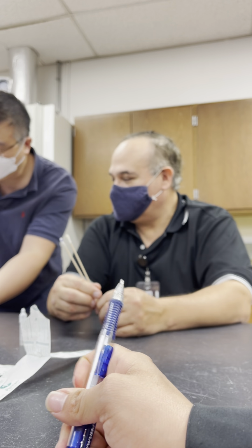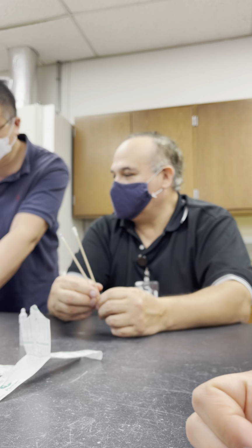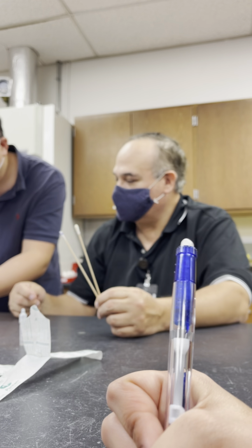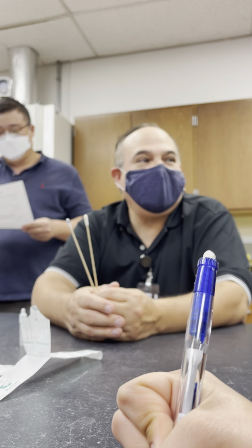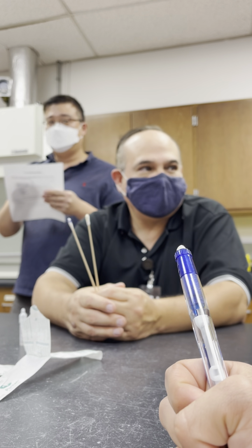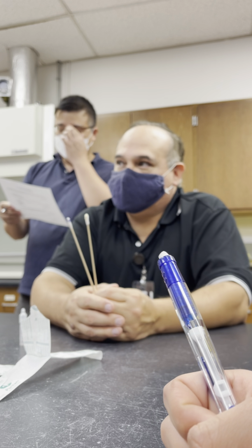That was negative, right? It would be negative, right? But that's not the one we used. We used this one. Okay. Good? It was the faecalis. Faecalis, that's the non-purple. No, purple. Purple. So it was aerobic.